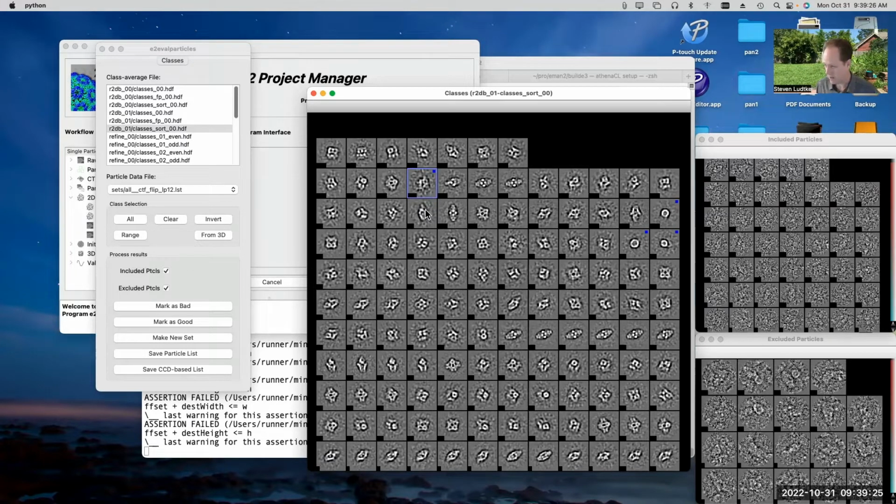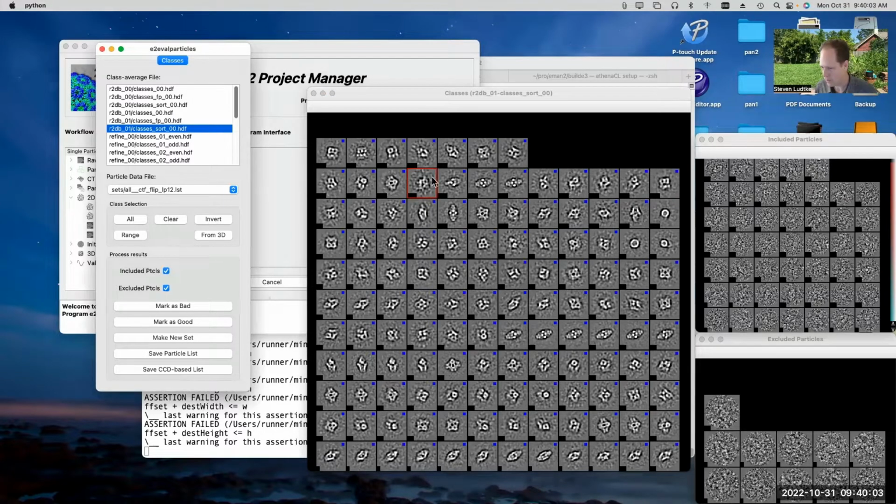And that's a progressive process. There's just one mark that you can put on each particle which says this particle is good or this particle is bad. So once you've marked the particle as bad, if I went back to this program again and picked some more and I marked them as bad again, that would just expand the list of bad particles. Or I could make a new set, and making a new set would make a set which contained only the particles that were marked. So if I did that, I would wind up with a set which contained only the bad particles. So if I want to get the good particles using the Make New Set button, I would hit the Invert button here, and that would invert the selection and select everything except for the things that I had previously marked. And then I could say Make New Set, and that would give me a new .lst file in the sets folder, which would contain the particles excluding the bad ones.